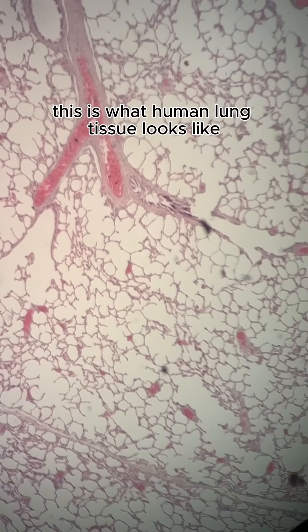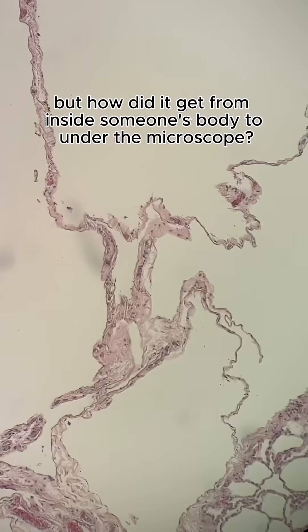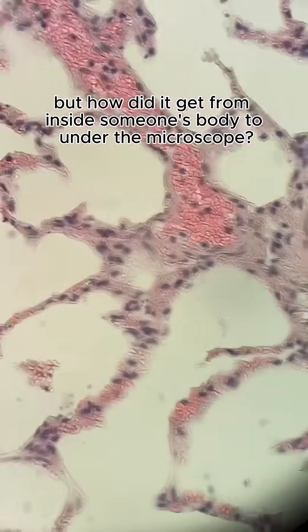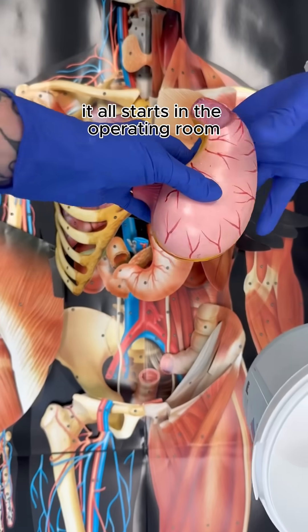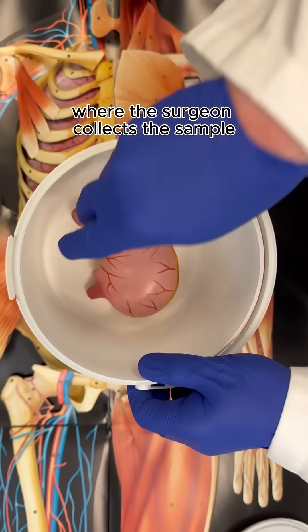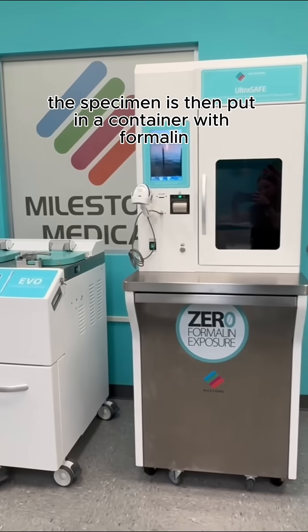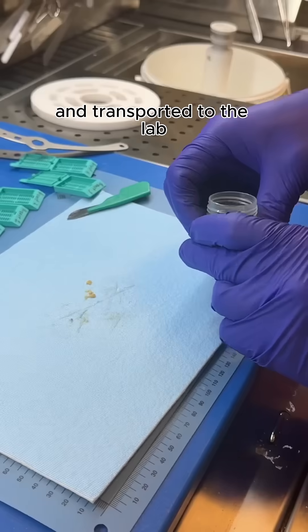This is what human lung tissue looks like, but how did it get from inside someone's body to under the microscope? Let's rewind. It all starts in the operating room where the surgeon collects the sample. The specimen is then put in a container with formalin and transported to the lab.